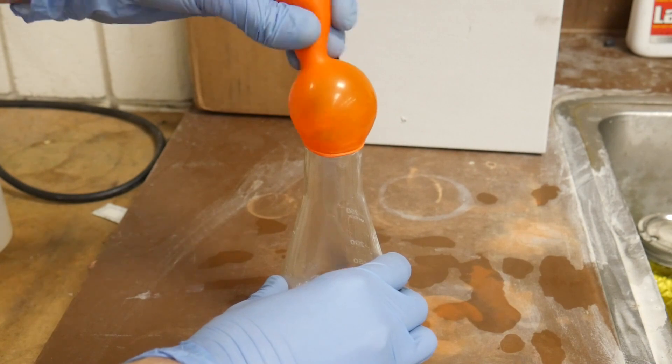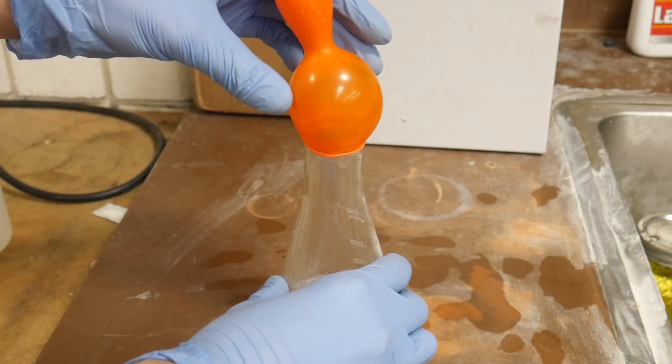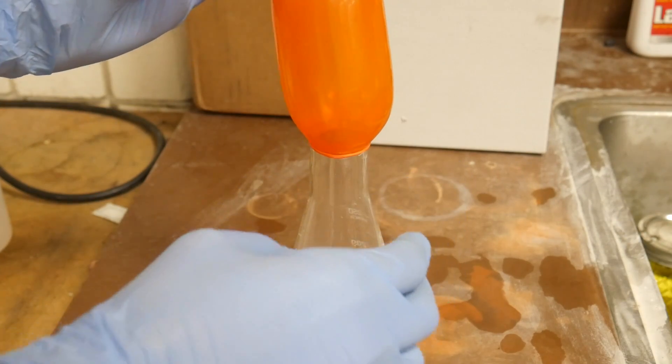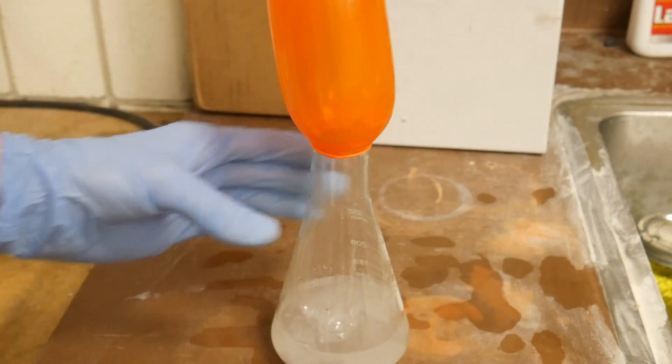Now that's weird. There the rest of it goes. Alright this balloon has decided to inflate in a weird way.